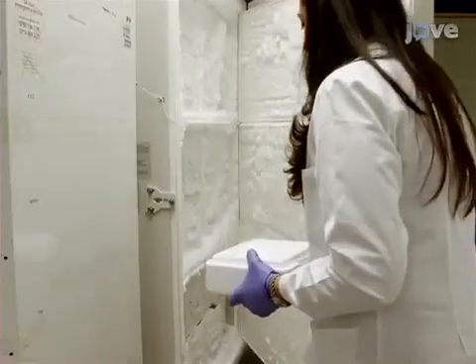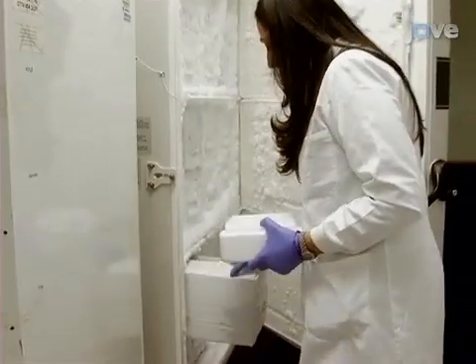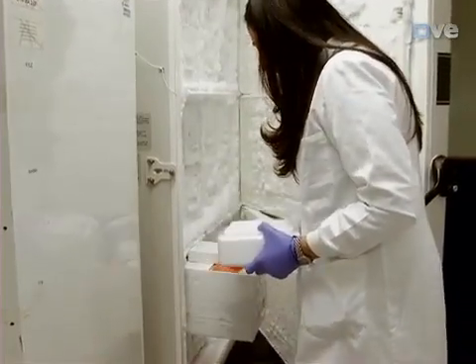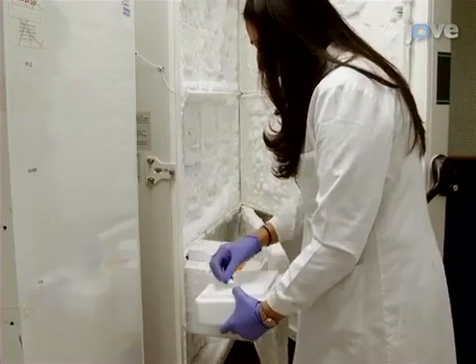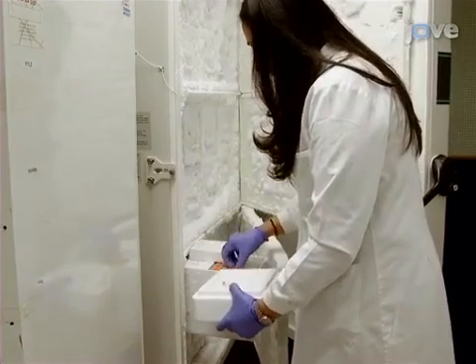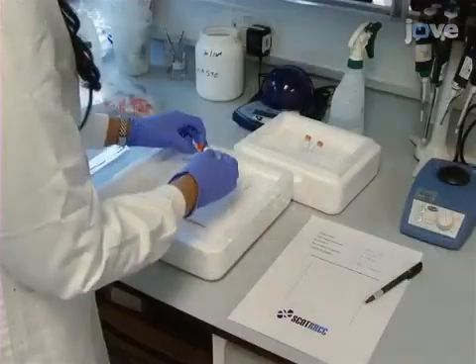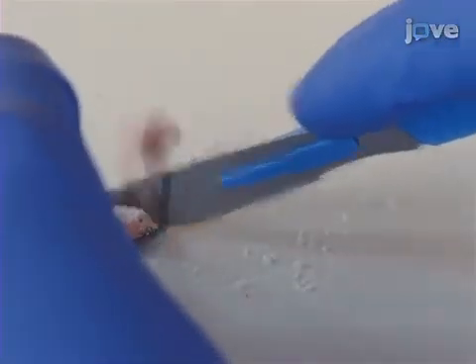To begin this procedure, remove tumours from the minus 80 degrees Celsius freezer and keep on dry ice. Divide tumours into sections of approximately one centimetre cubed.